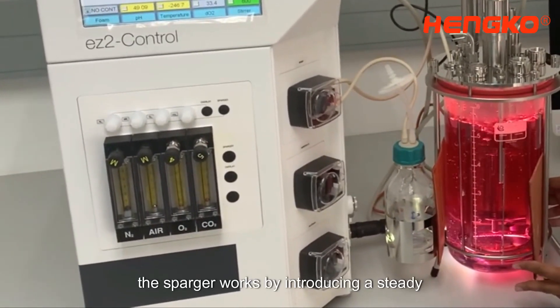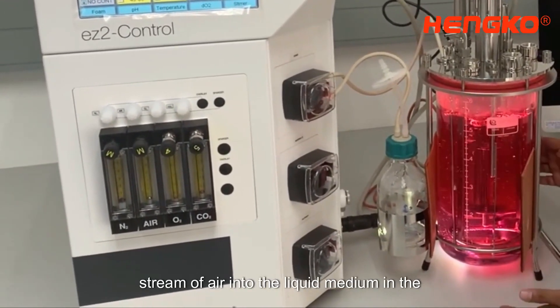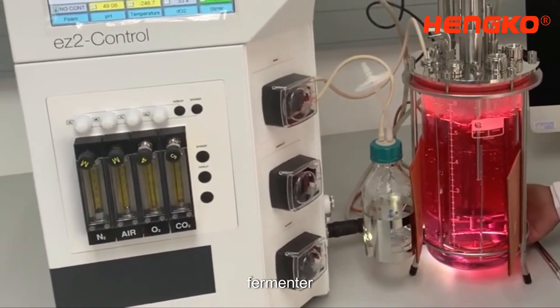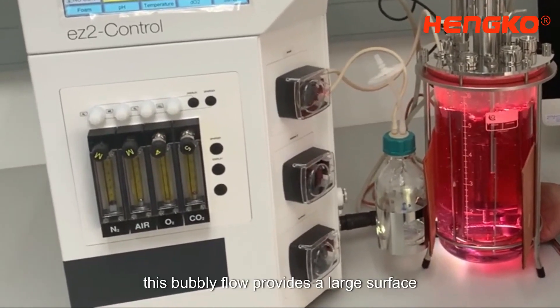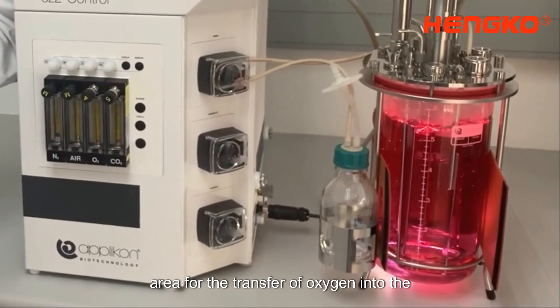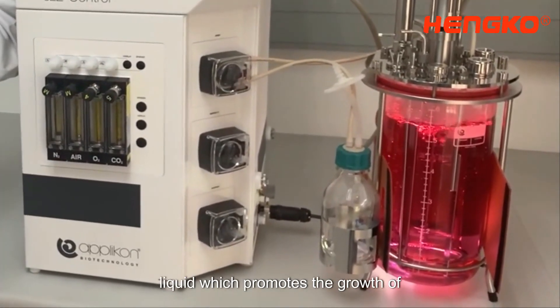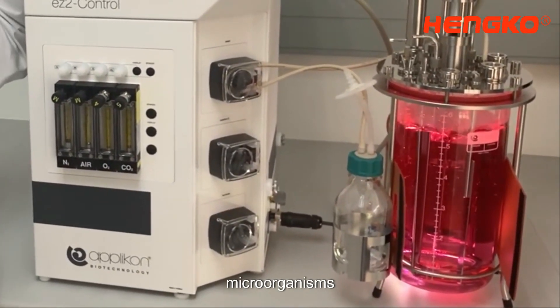The sparger works by introducing a steady stream of air into the liquid medium in the fermenter. This bubbly flow provides a large surface area for the transfer of oxygen into the liquid, which promotes the growth of microorganisms.